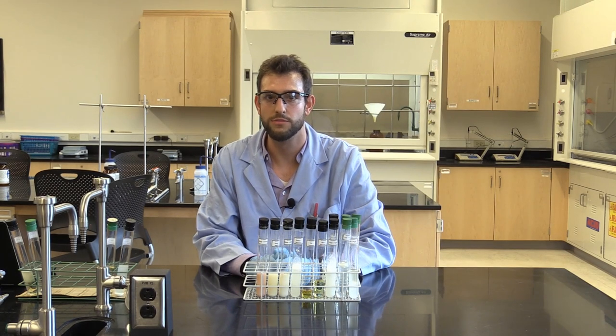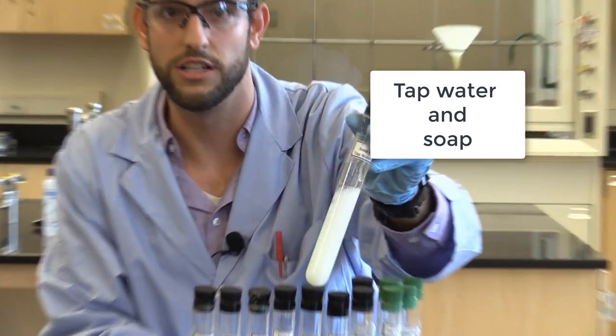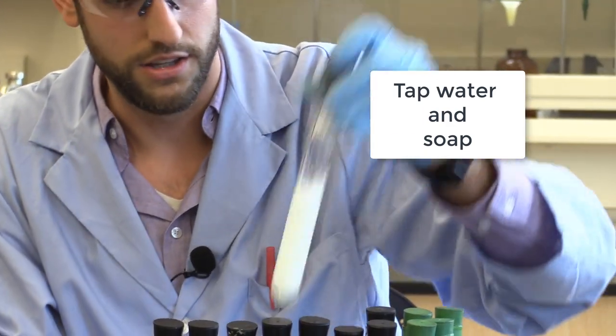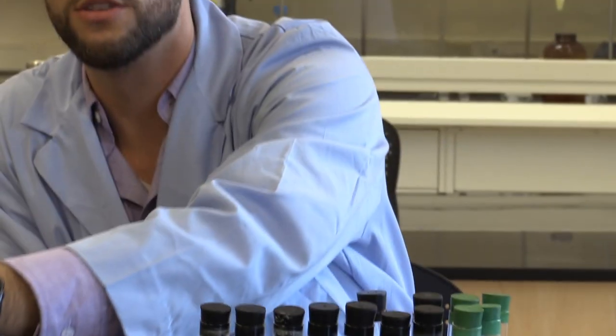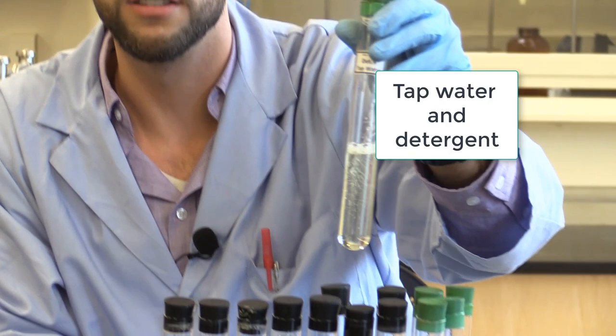Lastly, we look at the mixture of tap water and soap. And as you can see, the tap water is fairly cloudy in the mixture. And we also have detergent too. And you can see the detergent solubilizes that tap water better because that tap water has the hard ions in it.